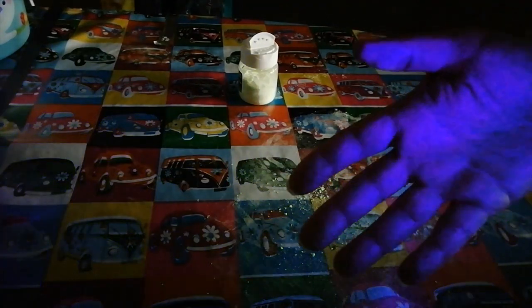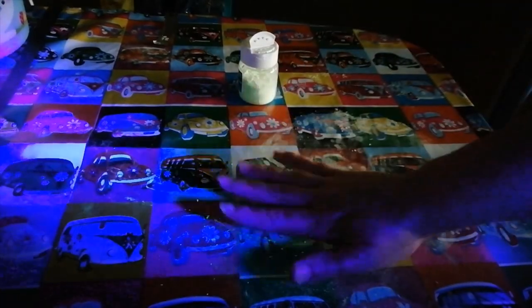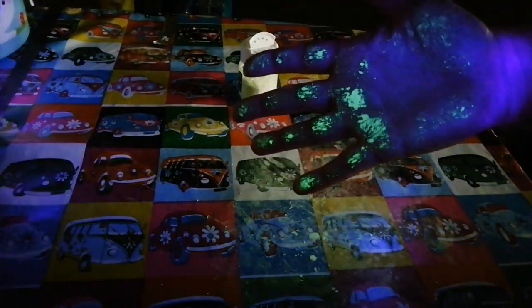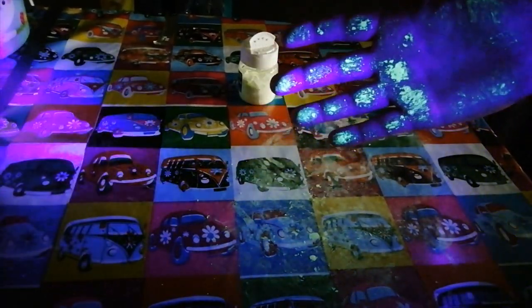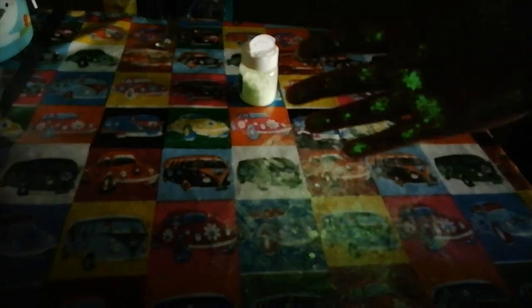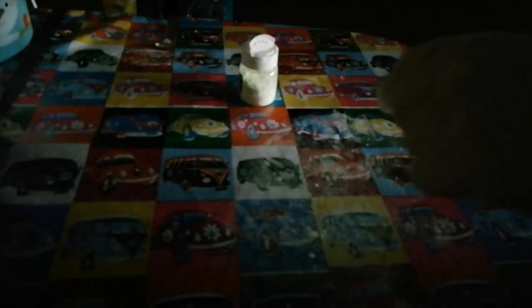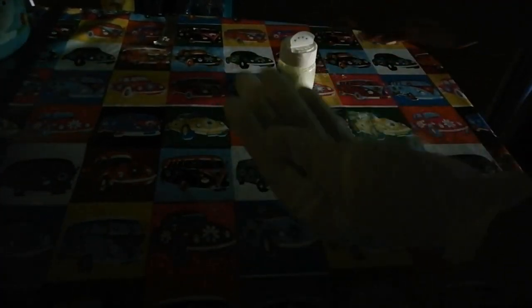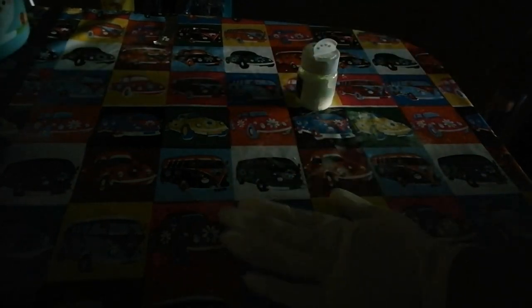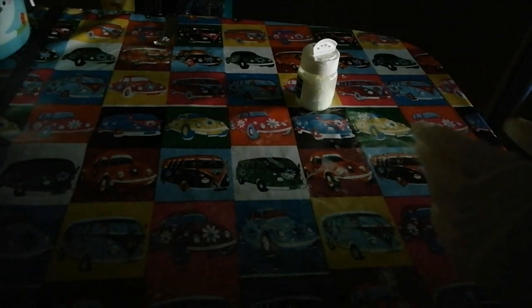So if you look at my hand at the moment — there's just a tiny spot there. I've just gone and contaminated that hand. With my other hand, which has been reasonably clean because it's been holding the torch, I'll put a glove on and expose that one to some of this simulant, get it all rubbed in. Obviously normally in real life you wouldn't be throwing radioactive powder into your hand, but you might get your hand contaminated as a consequence of just going about your work.